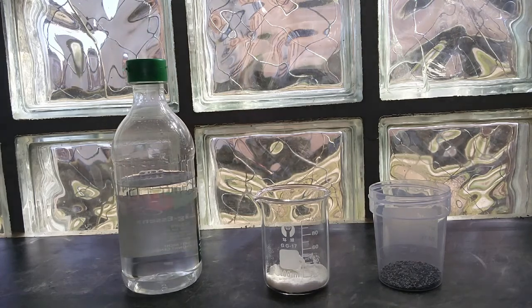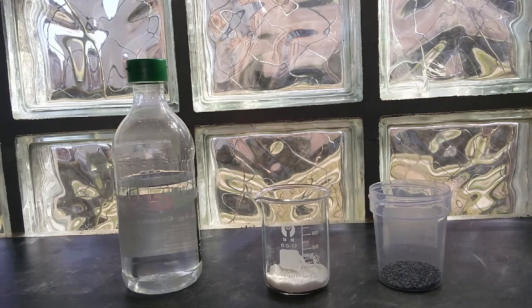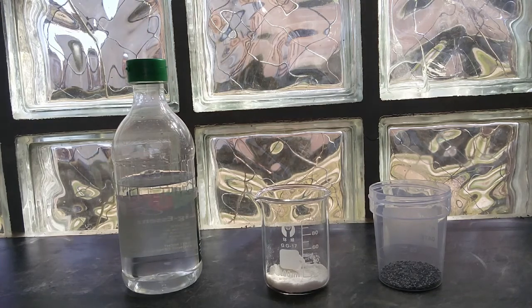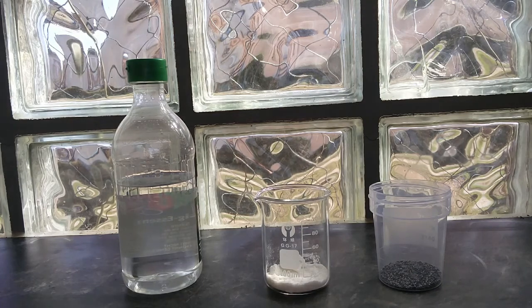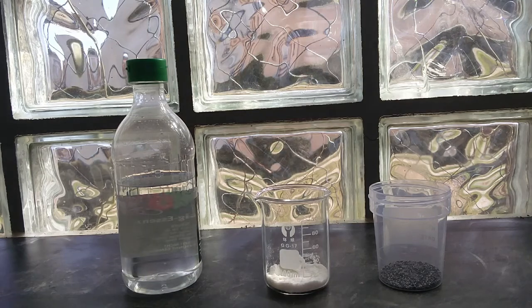To start with we only need three chemicals: potassium nitrate, magnesium turnings, and acetic acid. The idea with this experiment is to attack the nitrate ion with hydrogen radicals. These are formed before the bimolecular hydrogen, which is normally a product of the reaction, is formed. It's also called hydrogen in nascent state. This nascent hydrogen is much more reactive than normal hydrogen.